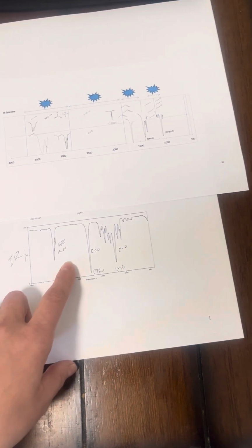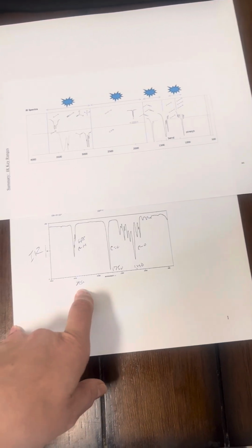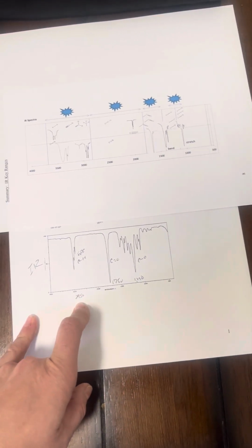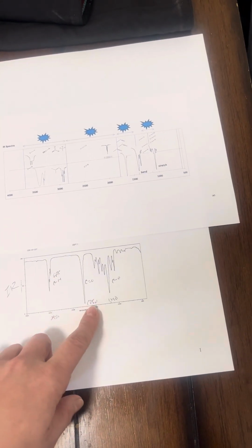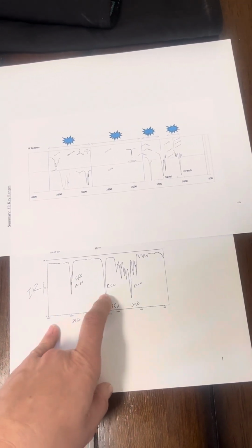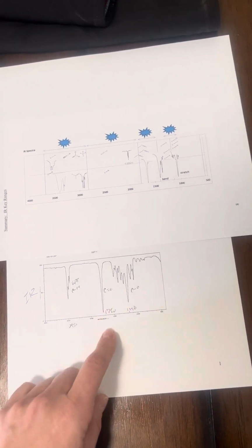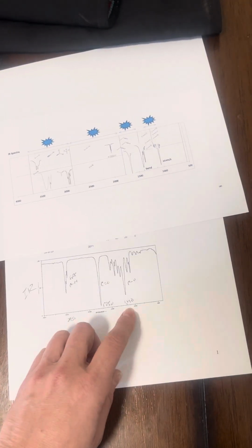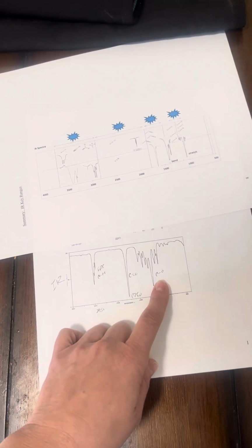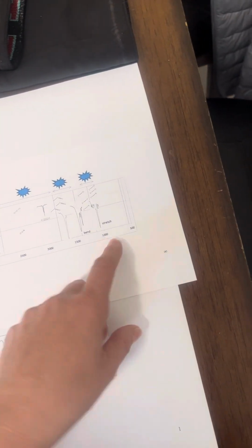As you can see, we have our C to an H right around 2950, most likely an alkane. Right around 1750, a C double bonded to an oxygen, which will be an ester group. And then right around 1190, 1200, we have a C bonded to an oxygen, and that's what that stretch is. You can see we can verify that using our chart.